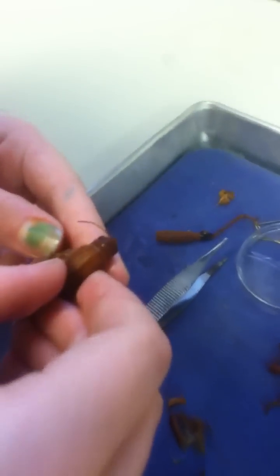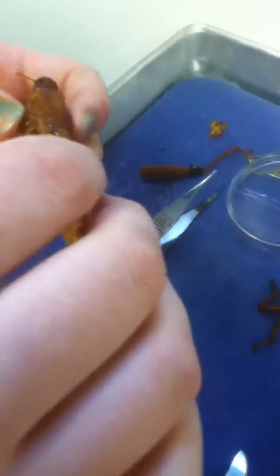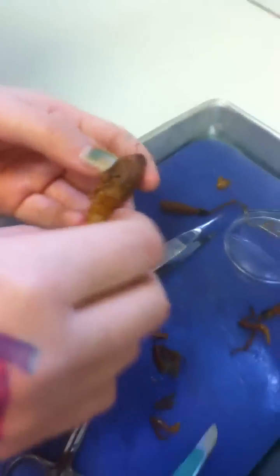What's the crop? Oh, should we peel off the skin? Or what? I think so. Seriously, it looks like chicken. It looks like chicken. It tastes like chicken. Ew, no, I'm not doing that.